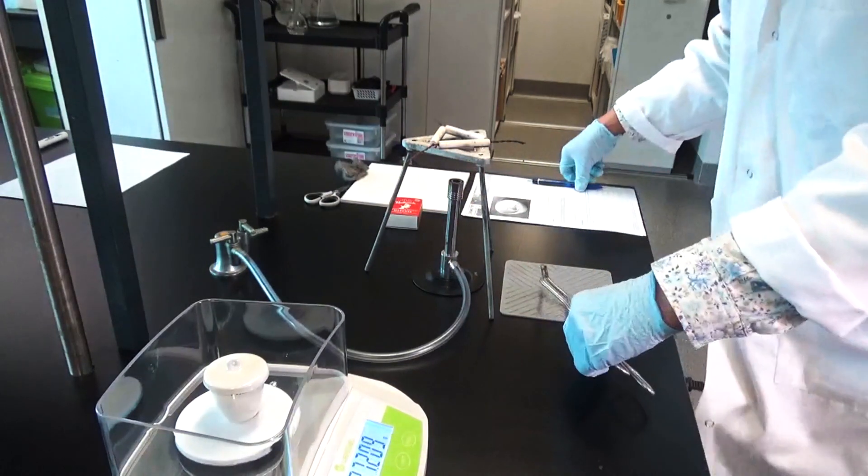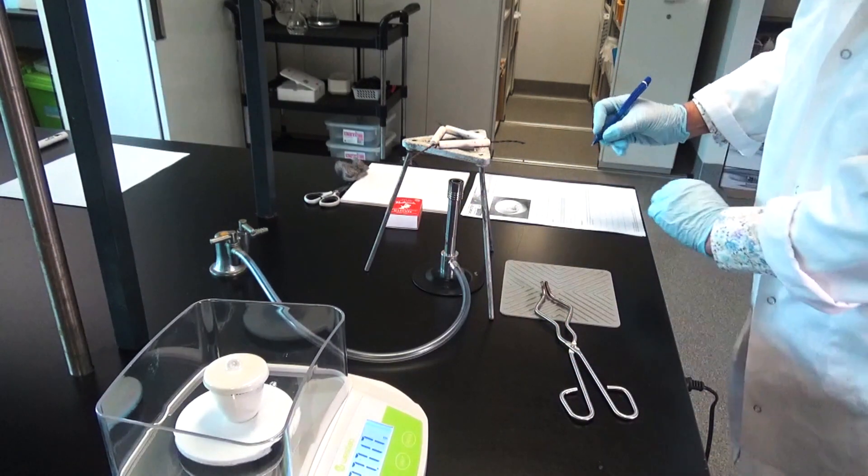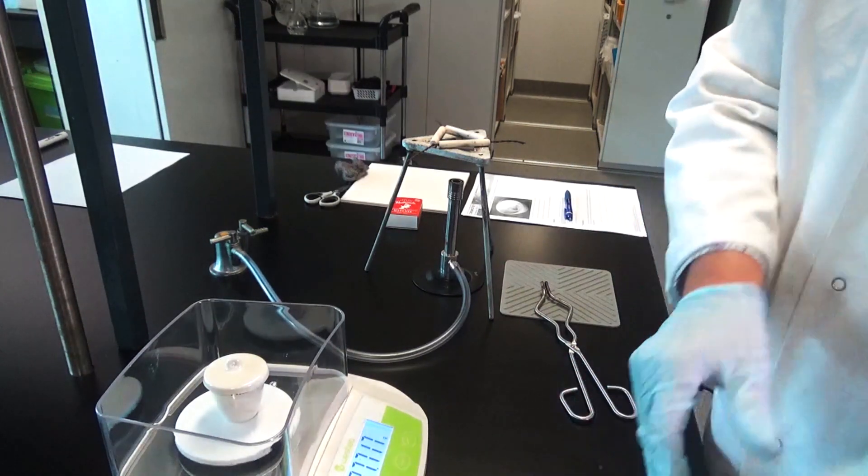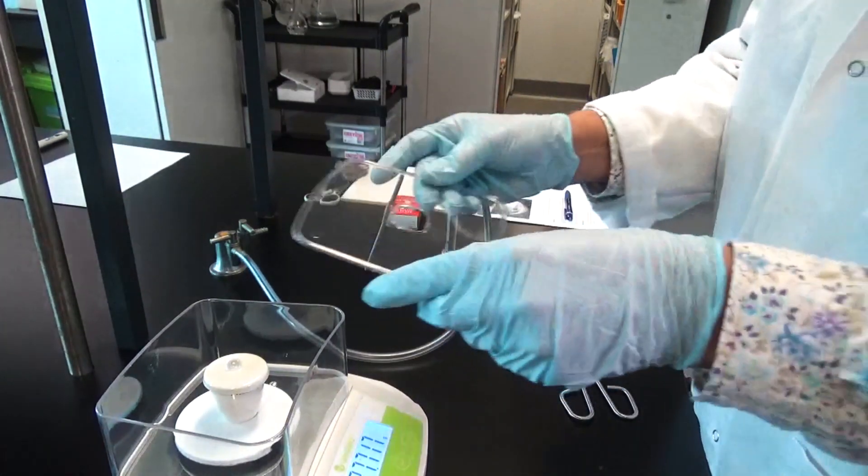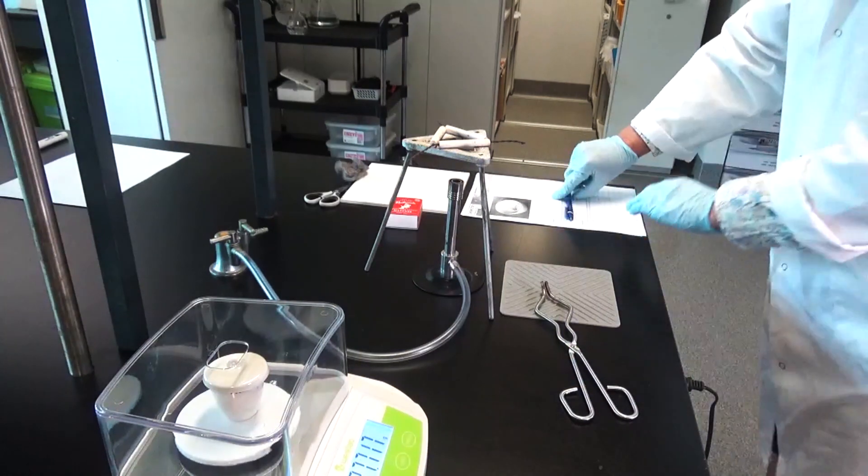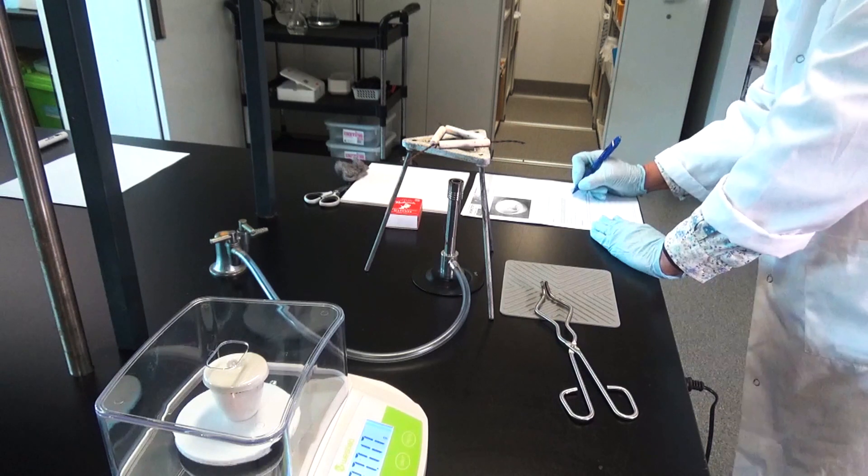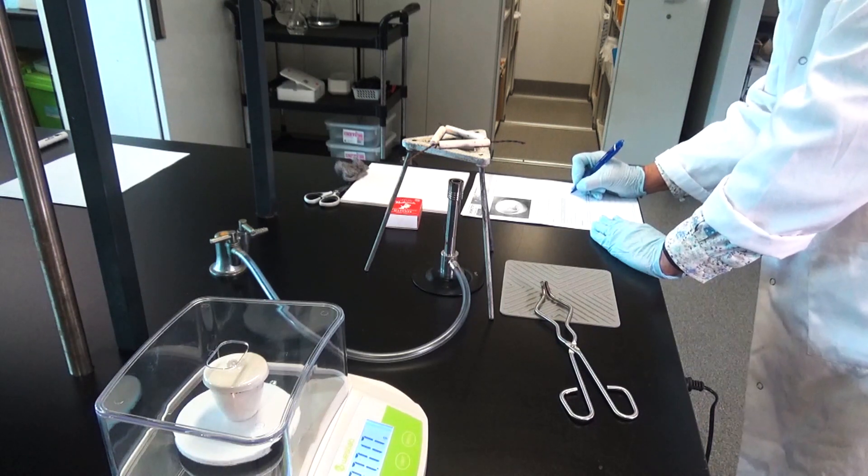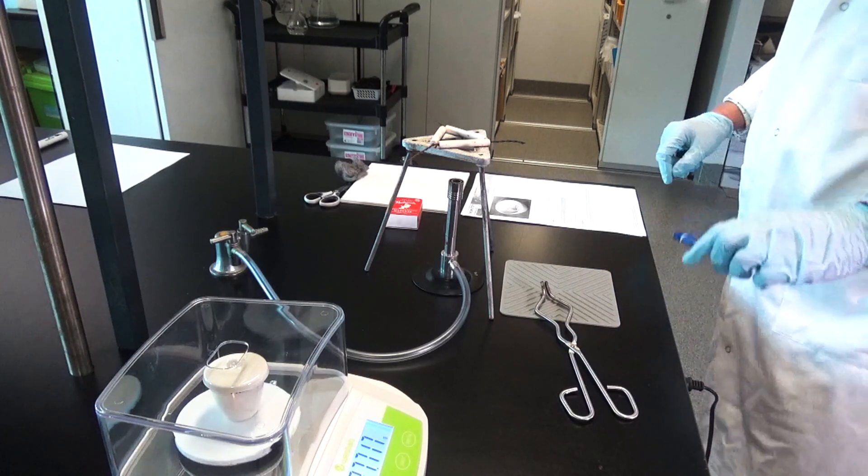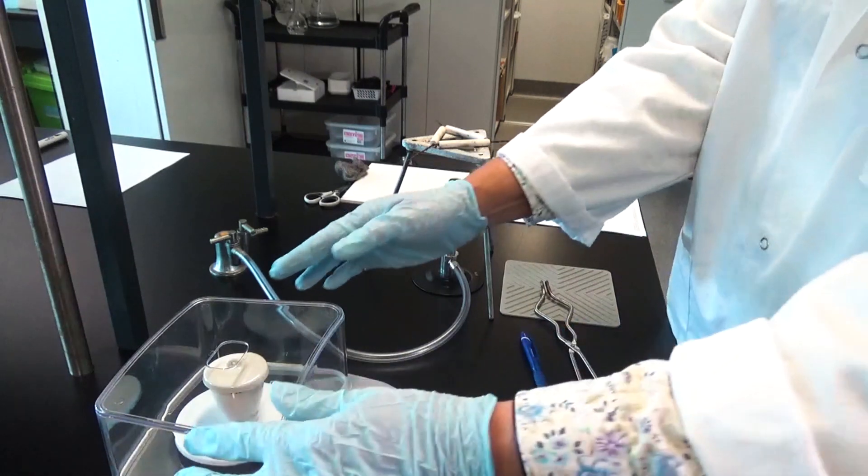Putting the lid back on. So now my magnesium and crucible and lid comes to 37.717 grams. So you can do that subtraction to see how much the magnesium ribbon actually has a weight of or a mass of.